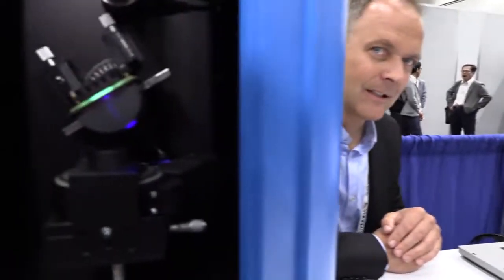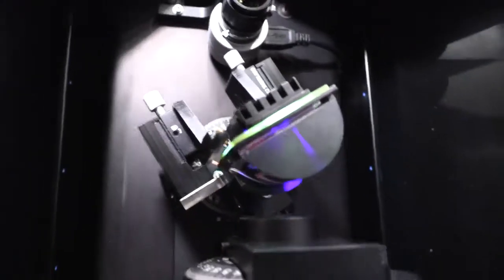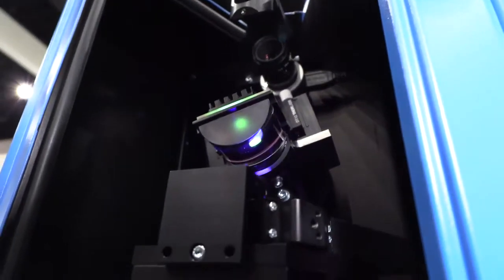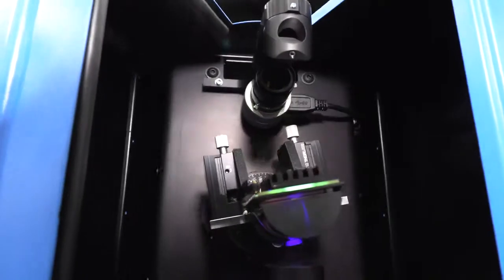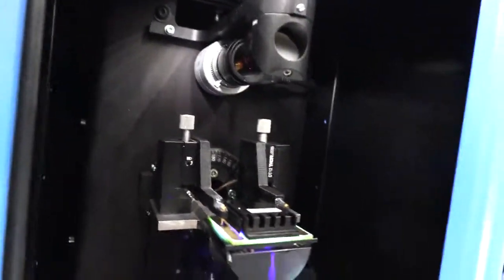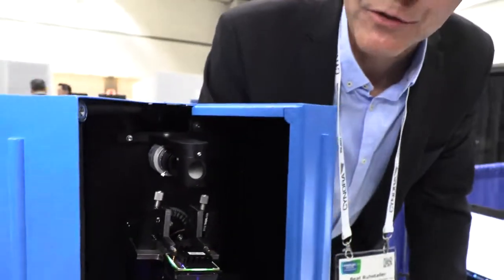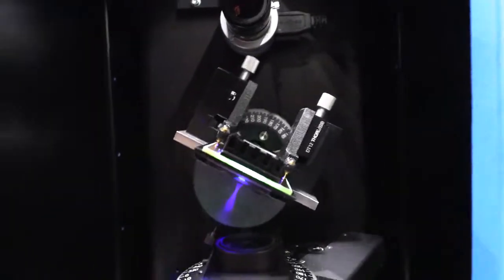So what are we looking at right now? What's happening? Is it turning and measuring something? Yes, that's the blue LED, UV blue kind of light that you see, exciting the organic film. The organic film emits green light. That would be the material in an OLED display of the green pixel material. And here it's just to get this data that we just saw in the product flyer.